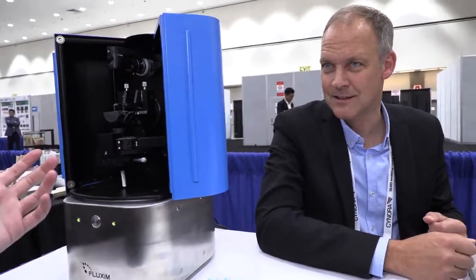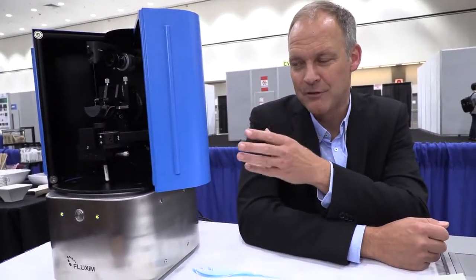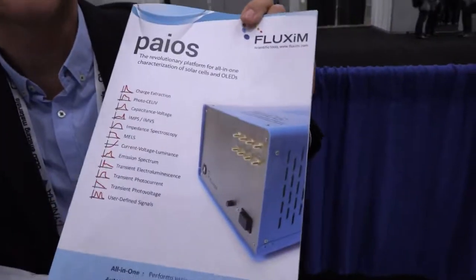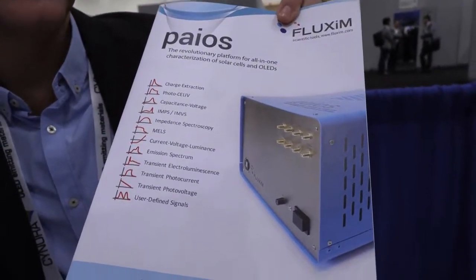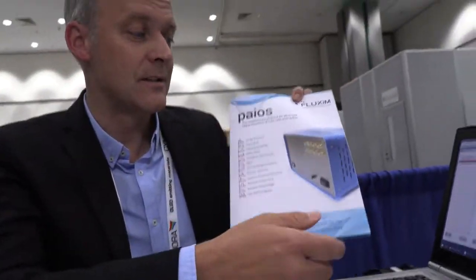And how many did you make so far? Is it secret? This one is brand new because it's a second prototype, and we are delivering in 2 weeks. We're delivering to the customer. For this other measurement equipment, we have already sold several dozens of these equipments to the worldwide OLED and solar cell industry. So all the researchers that make next generation solar cells or OLEDs can benefit from a very easy to use and very fast and reliable system.